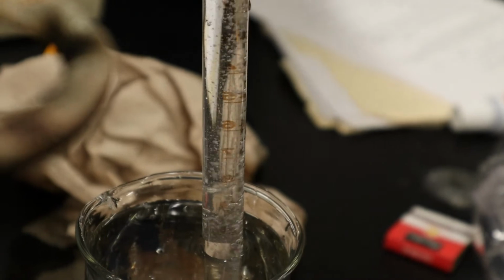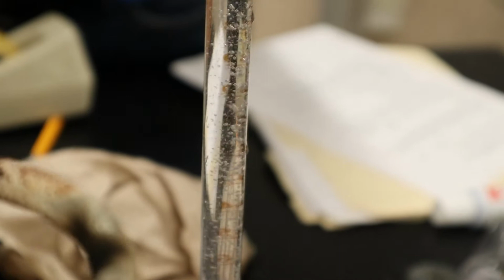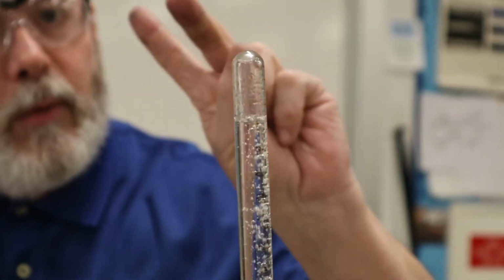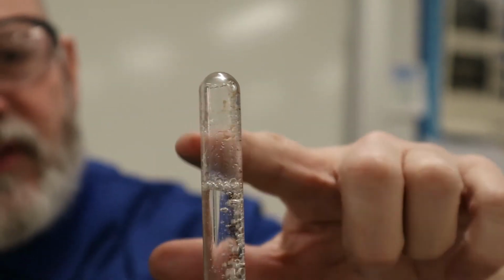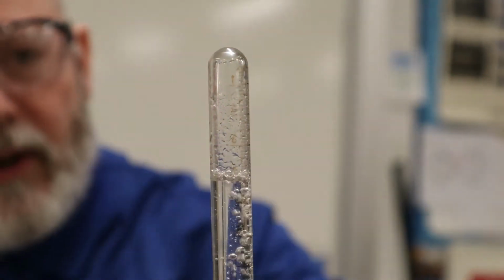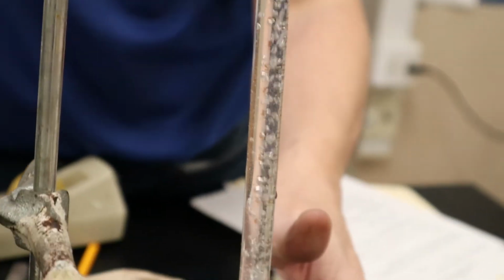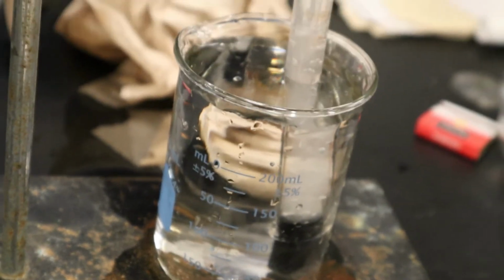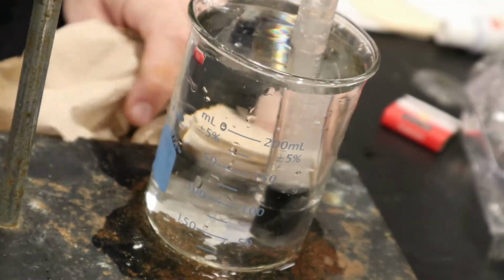And so the hydrogen gas is rising because H2 is the lightest molecule. So it's gonna float up through the water, and you can see the hydrogen gas being collected right here. Now, remember, no two pieces of matter can occupy the same space, so since the hydrogen gas is building up in here, it's pushing the water out. And that's why we needed holes in the rubber stopper so the water can come out. So the hydrogen gas is pushing the water out. That's why the level of water is dropping. And it's pushing it out into the beaker, and you can see it's overflowing, right?